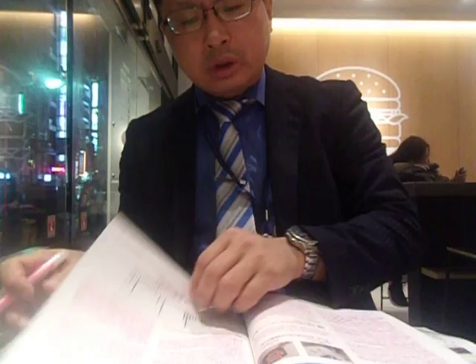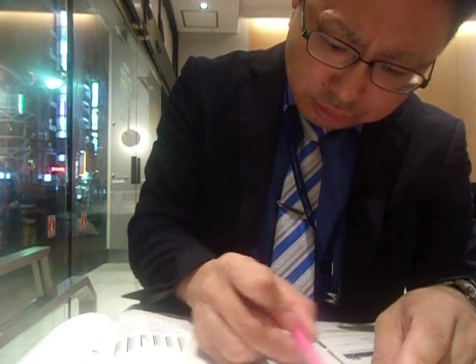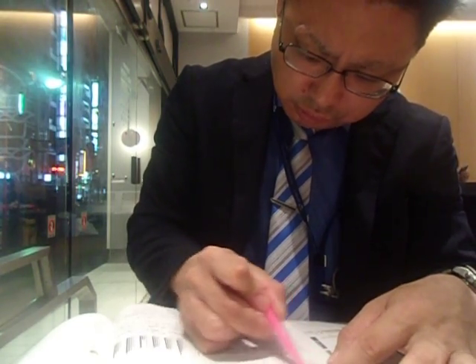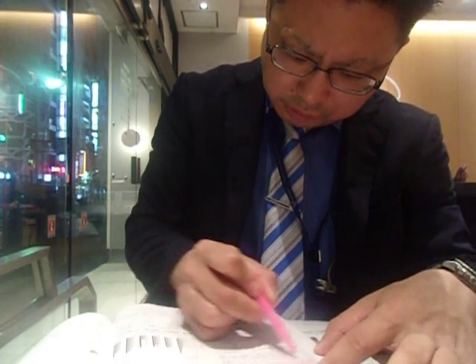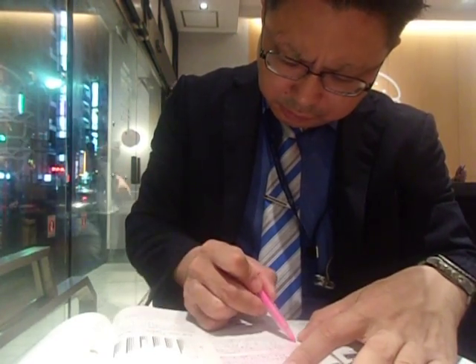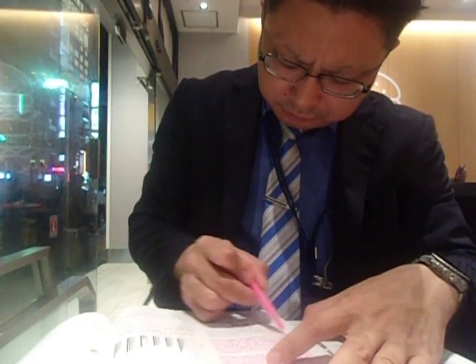Certainly not really a problem for point mutations, because the reads that have the variants are very clear. This we thought might be more of a challenge in the indel space because the types of errors that the PacBio sequencer makes were specifically insertions and deletions. We can see this variant was very highly recurrent, so something that we could call out on both platforms. And this is where it's very useful, especially if you're looking for challenging types of cancer genome variation, to have an orthogonal technology to validate what was discovered in one platform with something that's more complementary.